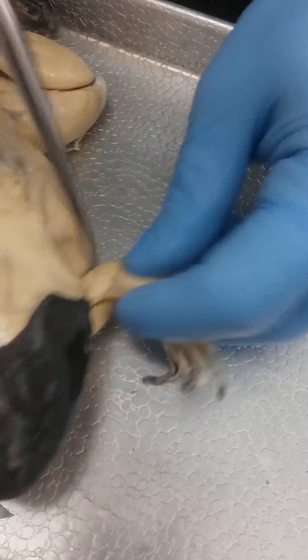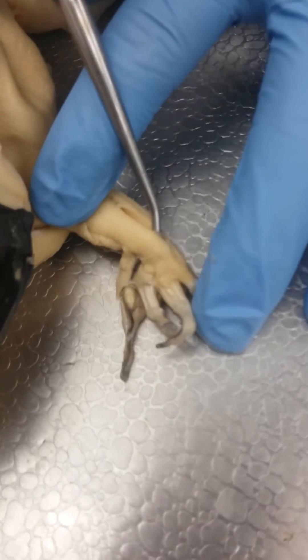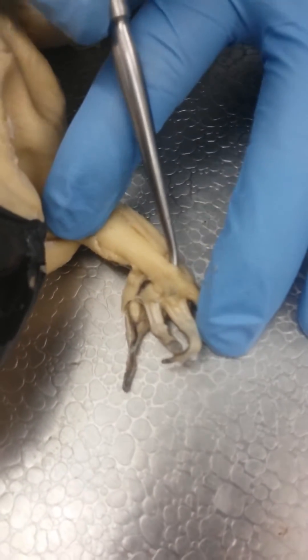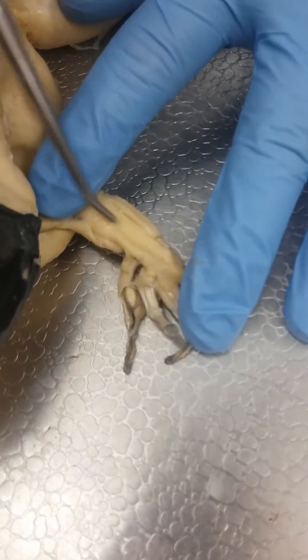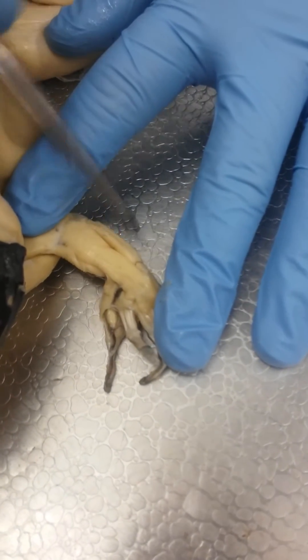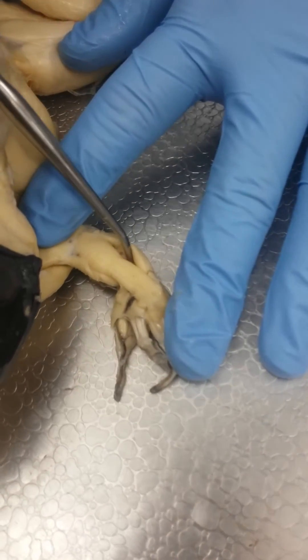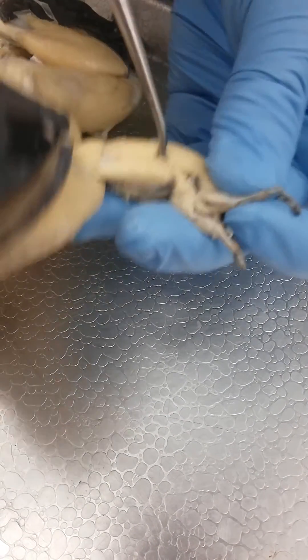In the hand, you can follow this one and how it connects to all of the fingers — that is extensor digitorum communis. And then this one right here on the lateral side is extensor carpi ulnaris. On the medial side, we have extensor carpi radialis.